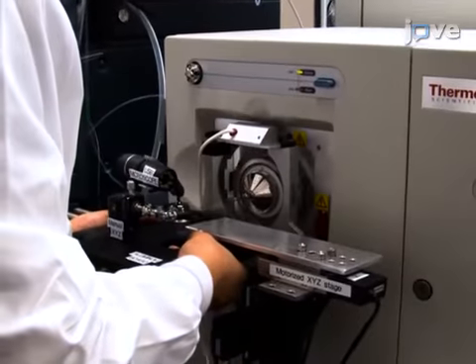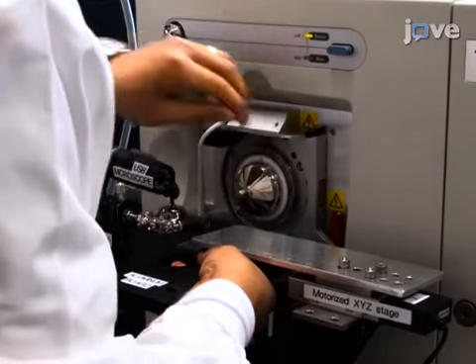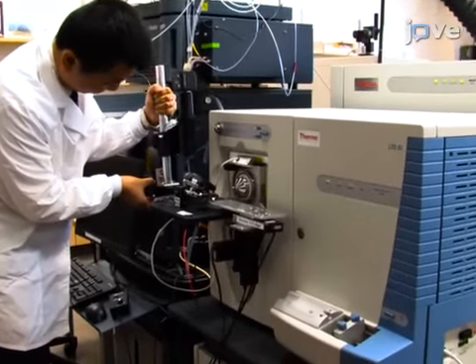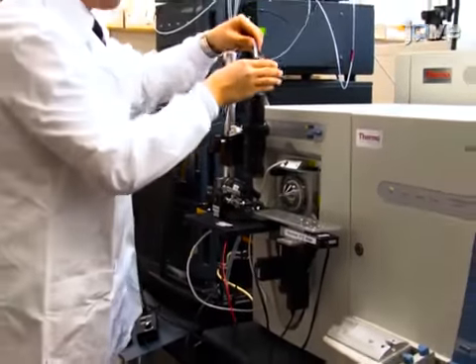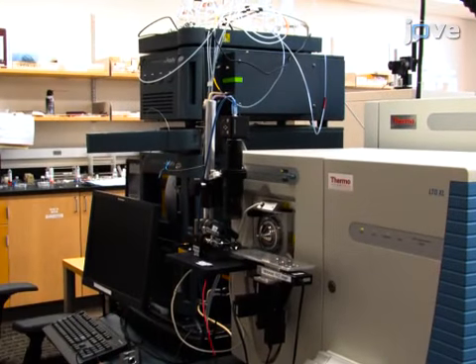This system includes a customized ion source interface flange of the mass spectrometer and an aluminum optical board that is attached with USB digital microscope, miniature manual XYZ translation stage, and the motorized XYZ translation stage system. Modify the ion source interface flange of the mass spectrometer and fabricate the stand of the digital stereo microscope as described in the text protocol.